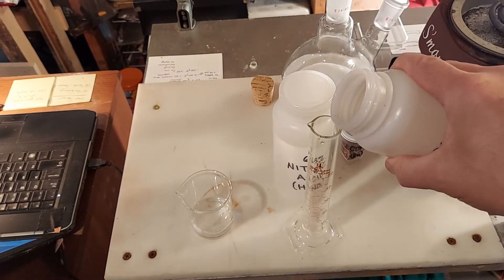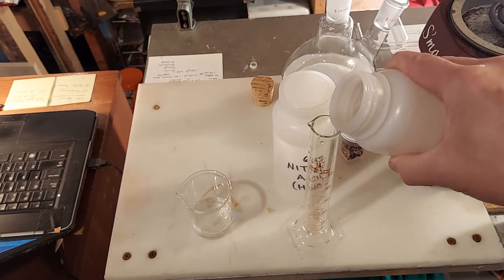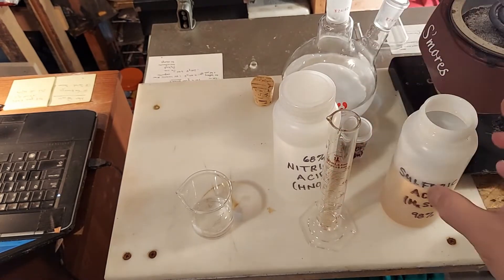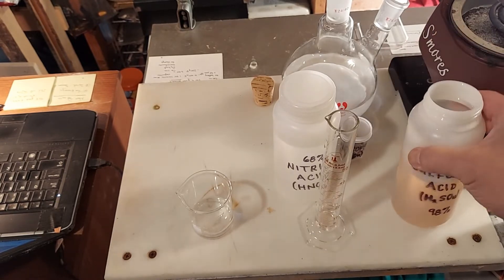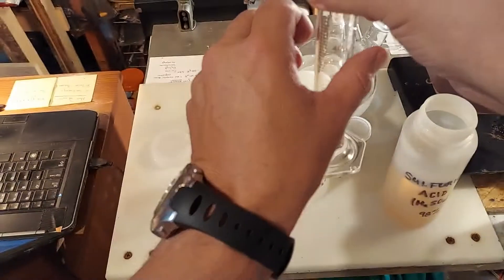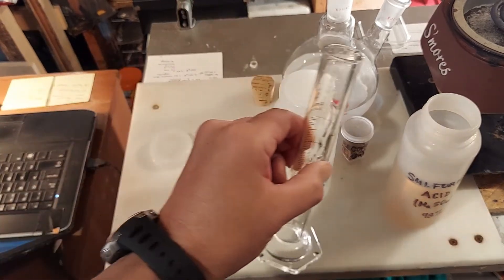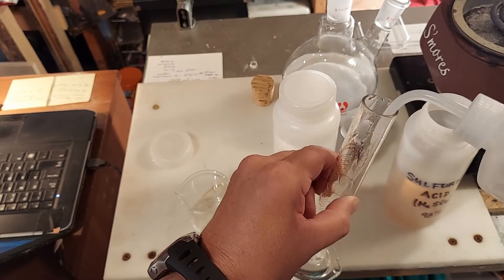5 ml of sulfuric acid — try not to get this on my fingers because it ran down the side. I'm going to rinse this out because I've put the nitric acid right in here; this will react rather strongly and that's no good.